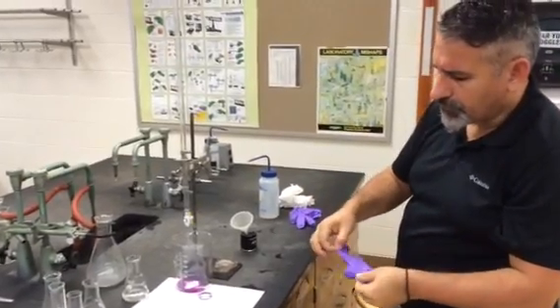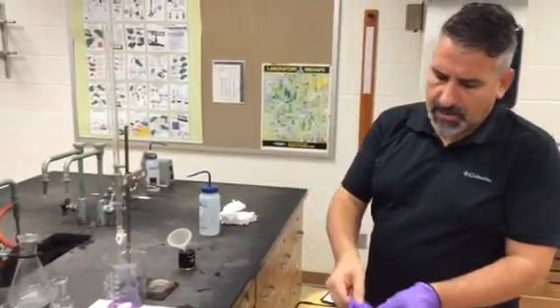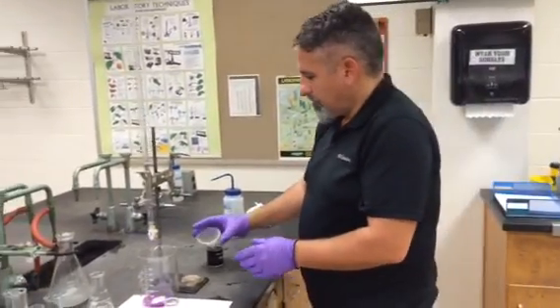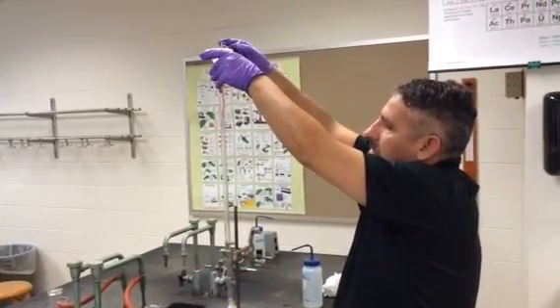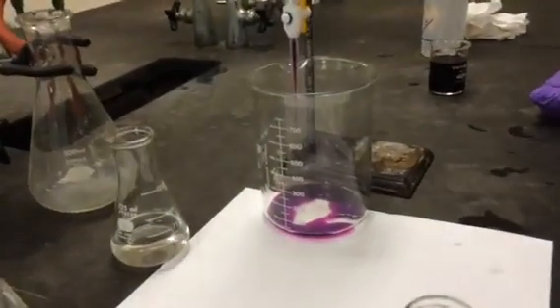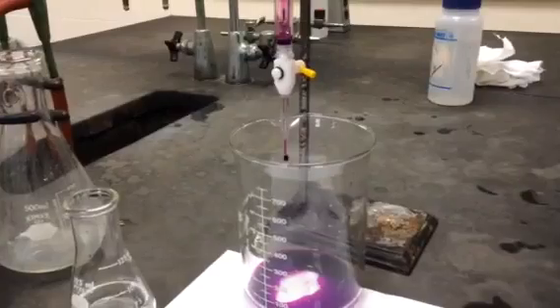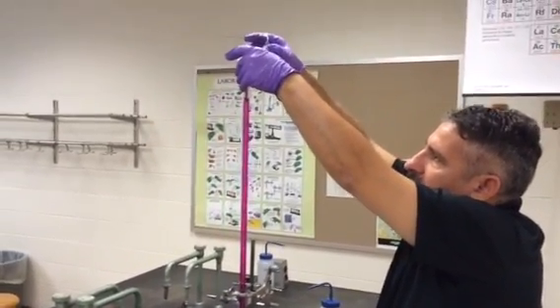The permanganate is not really very dangerous; however, if it goes on your hands it's going to stain them for a very long time. After a couple of days there will be a redox reaction and it's going to turn brown, staying that way for a week or so. So for those students who have an active social life, they will not want brown stains on their hands. I'm going to put some permanganate in to rinse my burette, let it come out, then close it and fill it, going above zero to adjust as needed.